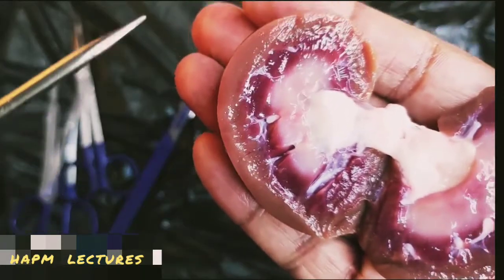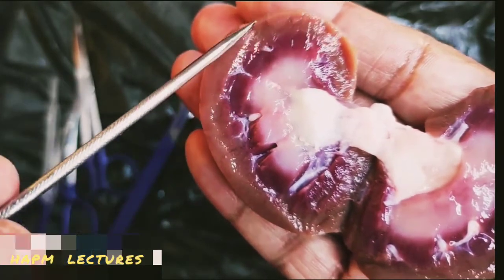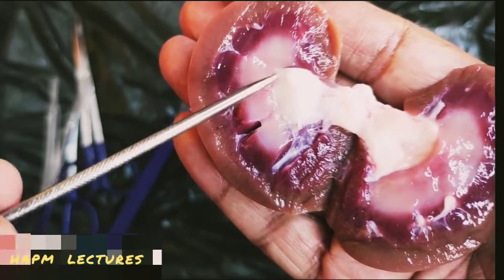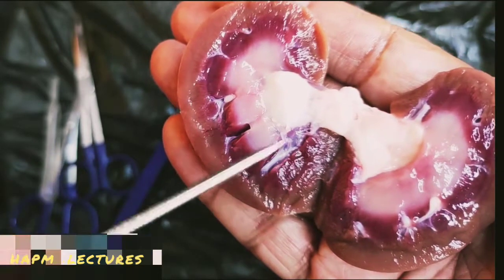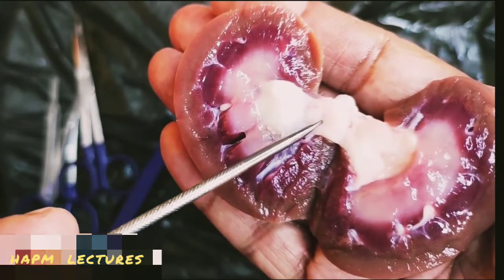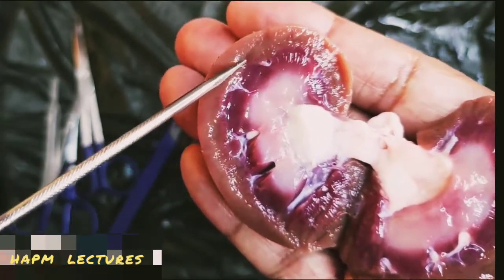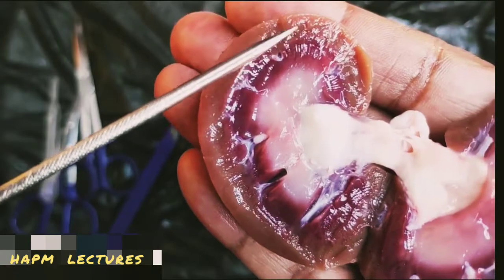Now this is the pelvis. Here this one is the cortex. Here we observe a number of Malpighian bodies, as well as the convoluted tubules. Here the pelvis, here the calyx, and they continue to the pelvis. Then these are all medullas. The medulla has the calyx, which continues with the pelvis, and then it comes out from this kidney and continues with the ureter. Here the filtration actually takes place. The urea, the nitrogenous waste, is filtered through these Malpighian bodies.